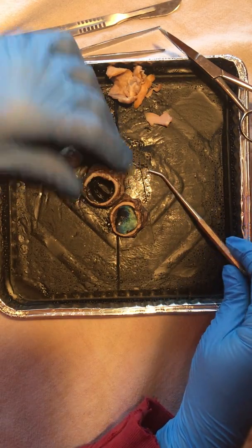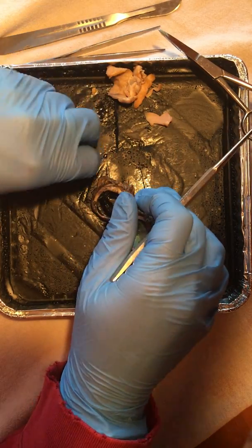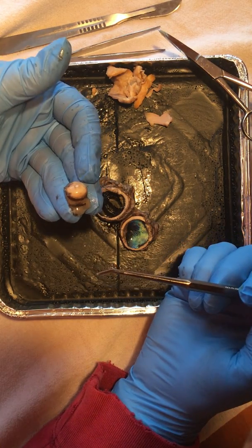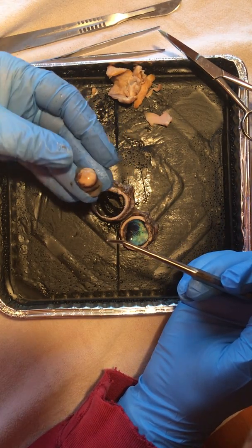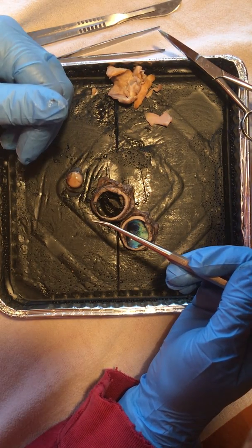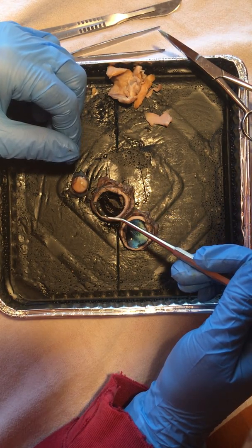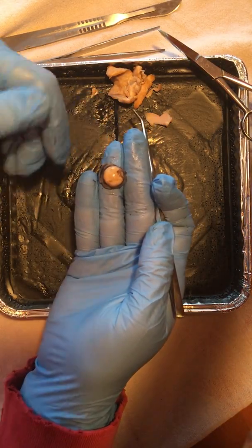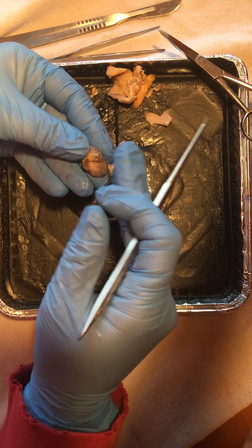So when we look a little bit more closely here, it's almost like the inside of a mushroom cap. There are different ciliary bodies and muscles that hold all of this together. These suspensory ligaments control the size of this lens and hold that lens in place. So that's pretty interesting as well. We also have the hyaloid fossa, and that's that indentation here in this vitreous body that's going to support this lens. The other thing to note is the zonula, which is the ligaments that suspend and hold the lens in place. It helps us focus on vision by stretching, dilating, and constricting.